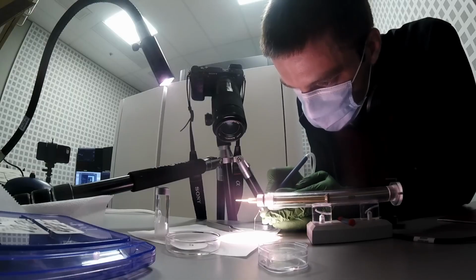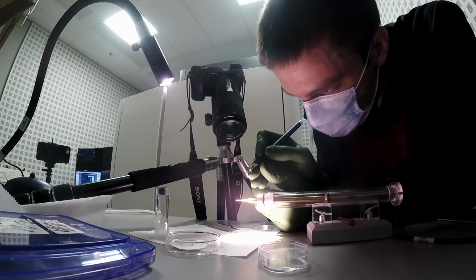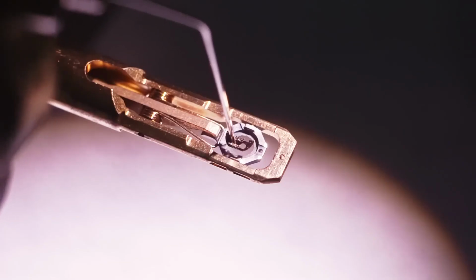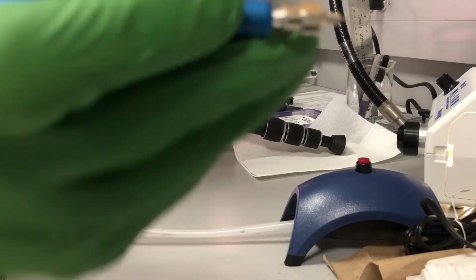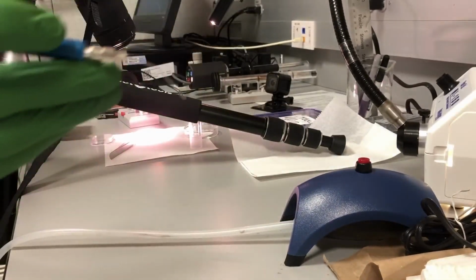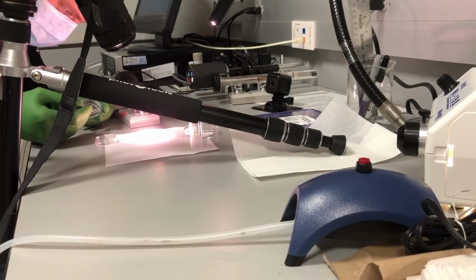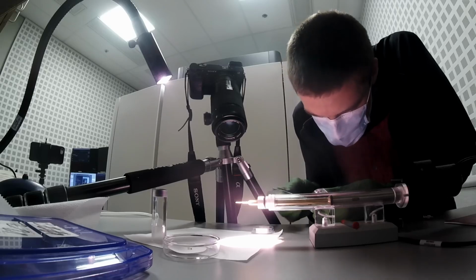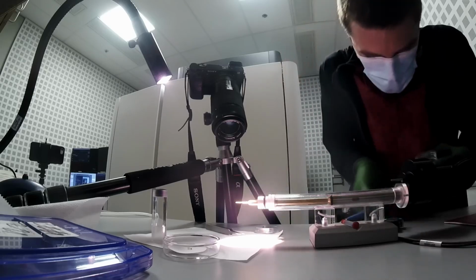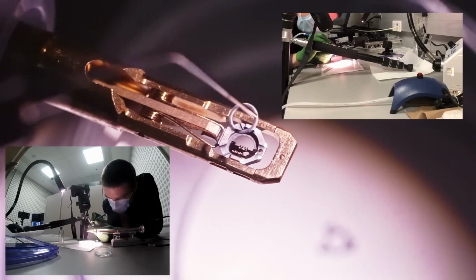Even though this copper crescent is vaguely 100,000 times larger than the dimension we care about on the sample it's holding, it's still small enough that it's a pain to work with. So to help, we've got these fancy vacuum tweezers. Basically a tiny hose that sucks up the sample like a piece of cardboard stuck to a shop vac. This is more than a little finicky, and while trying to bend around to give the camera a good view, I actually dropped it the first time. Crud. Something like this could only happen when I tried to film it. Thankfully, the sample itself was all right.